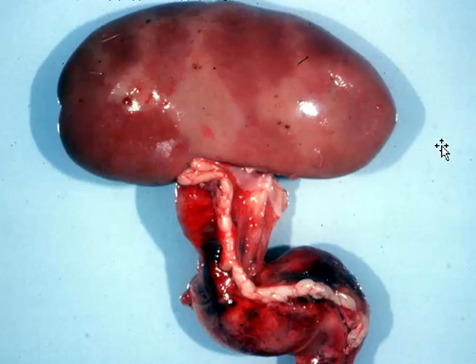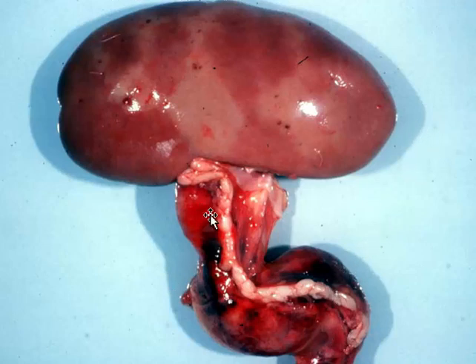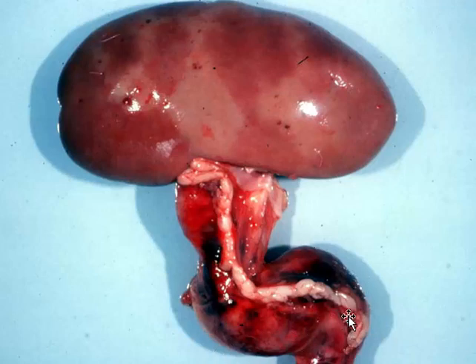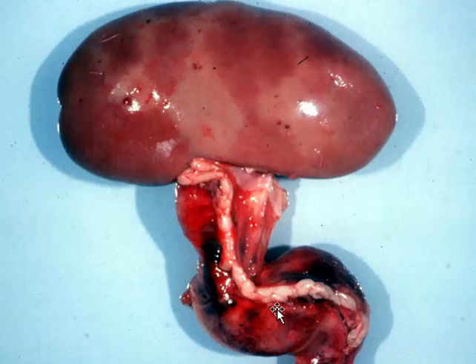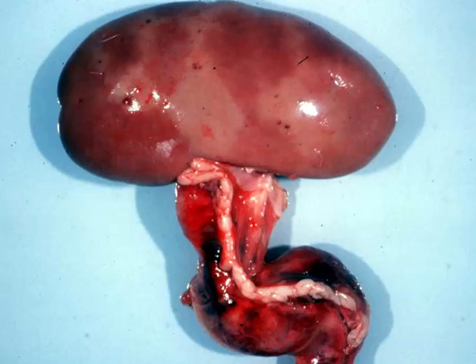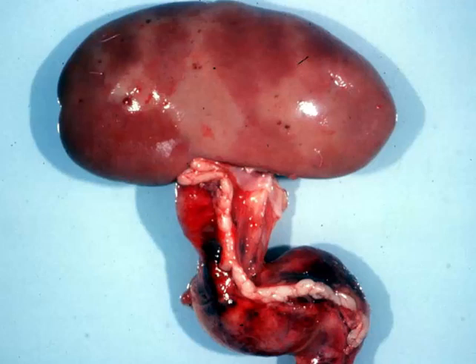What I really want you to focus on is a necro-hemorrhagic and proliferative — possibly eosinophilic — ureteritis. There is a nematode parasite that loves this area, and this is Stephanurus dentatus. Stephanurus used to be a very common parasite; now that most pigs have been moved off of dirt, we don't see it much anymore.